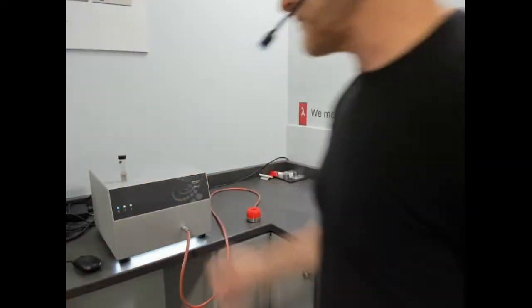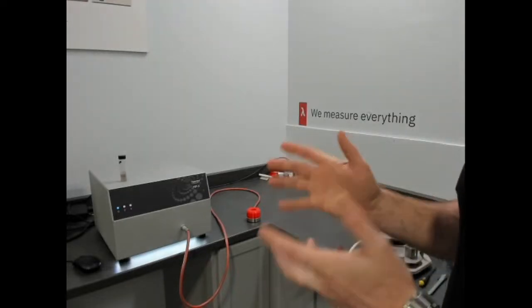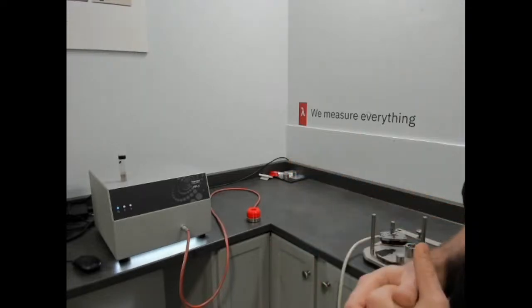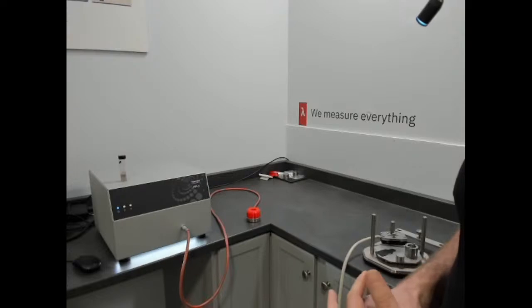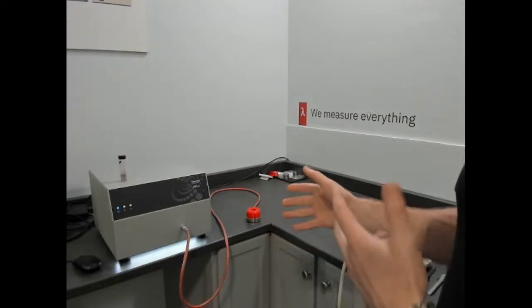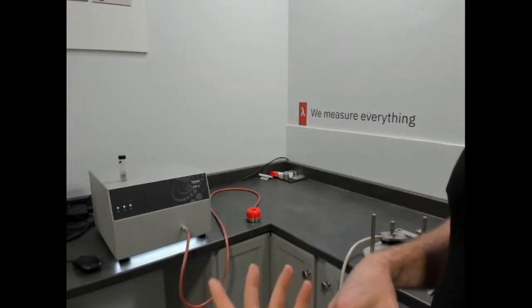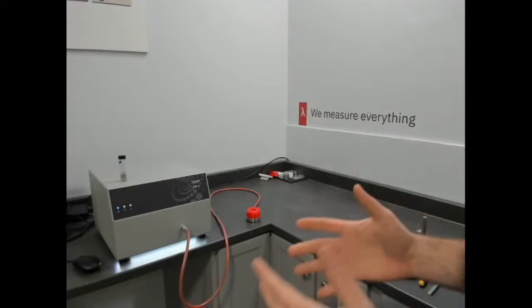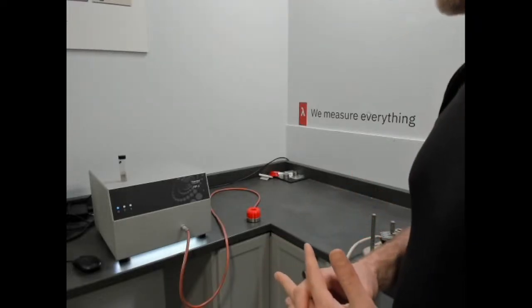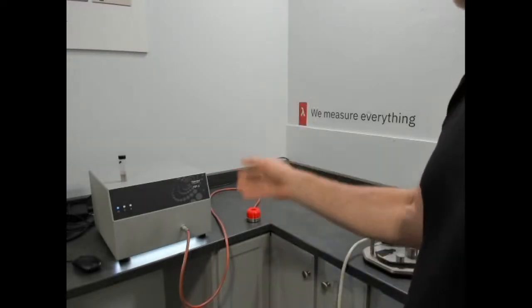But a little bit about the MP-V. This was an evolution of our early TPS-2, which was only transient plane source, and we've combined multiple methods into a mid-range instrument. This was really needed by our customers that have that mid-range purpose, that don't need the full capability of the MP1 and need more capability than our MP2, but want the advantage that comes along with multiple absolute methods of measuring thermophysical properties.